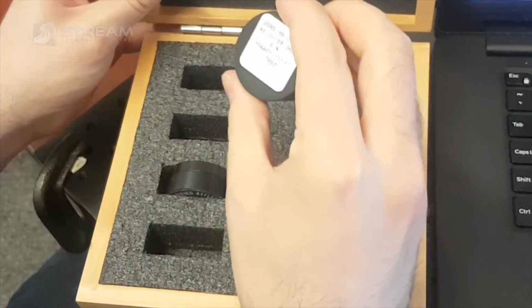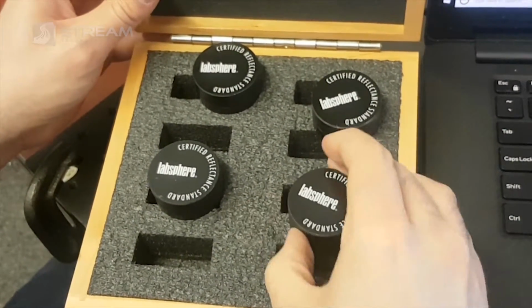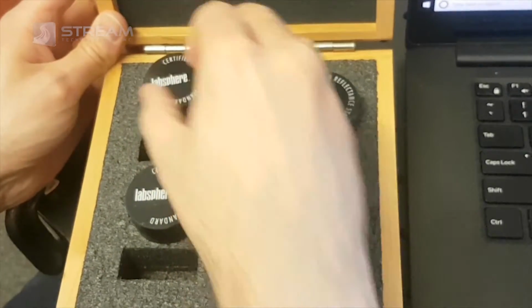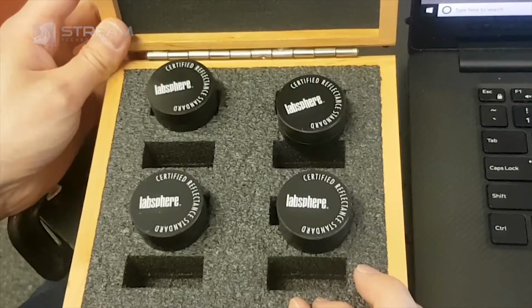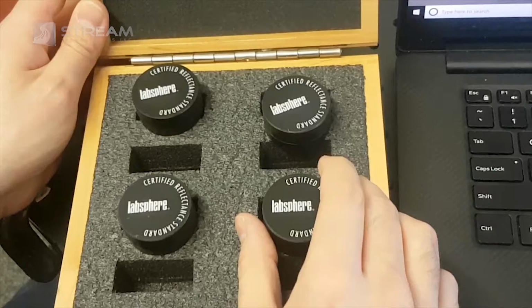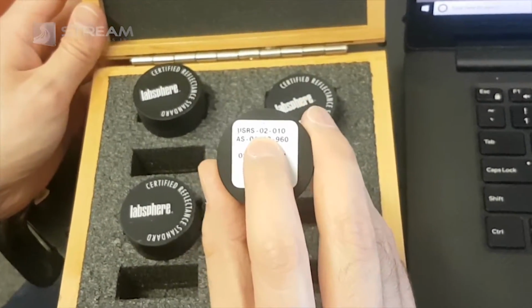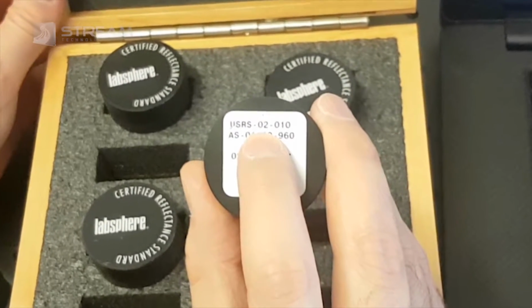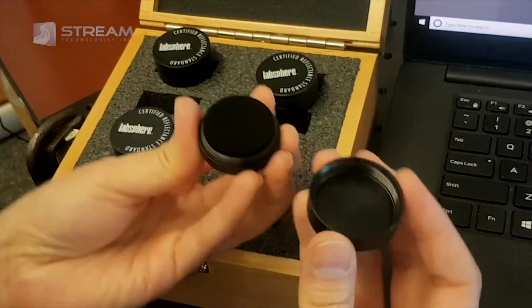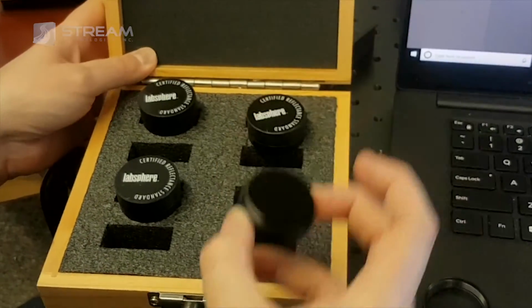We've included 4 for this process. They reflect a certain percentage of light back over a wide range, and this way we can accommodate for any kind of differences in how the spectrometers respond to different intensities of light. So the first standard we need to put in there is a 2% standard. If you just look on the back of them, they've got a number listed there that tells you what percentage reflectance they have. So I'll just open this up. There are little screw-on tops, so just take them out like that. You can see this one's a 2%, so that means it only reflects about 2% of the light back.